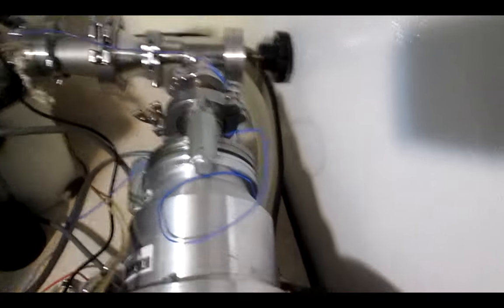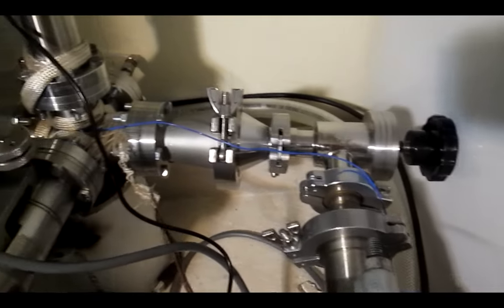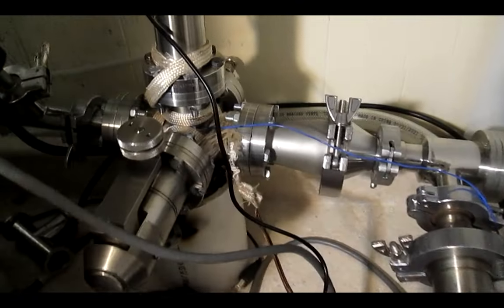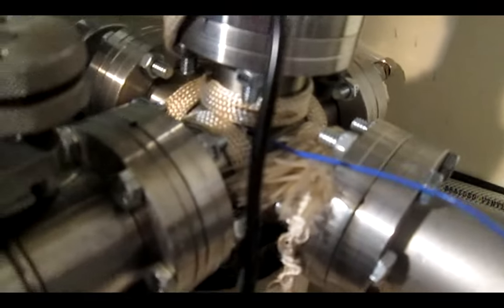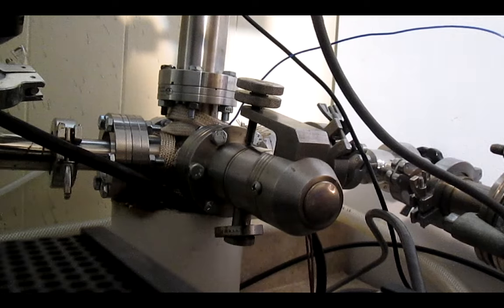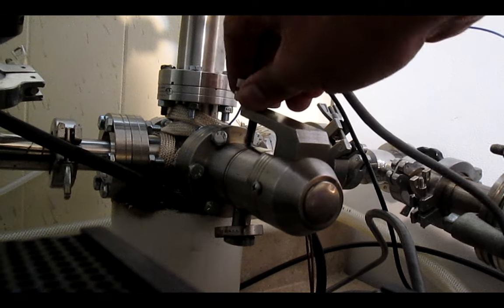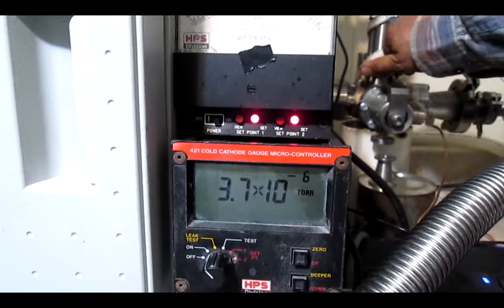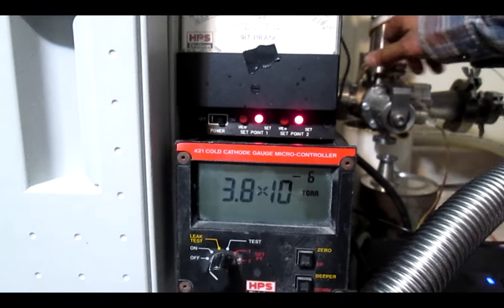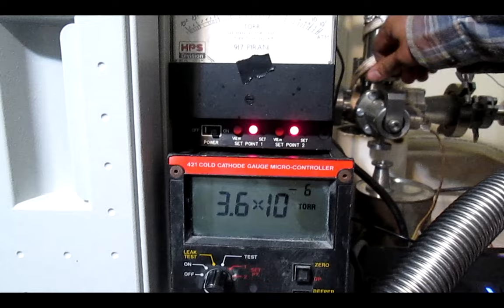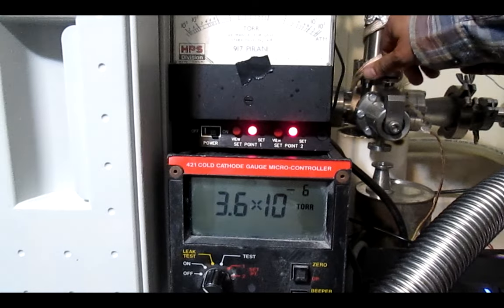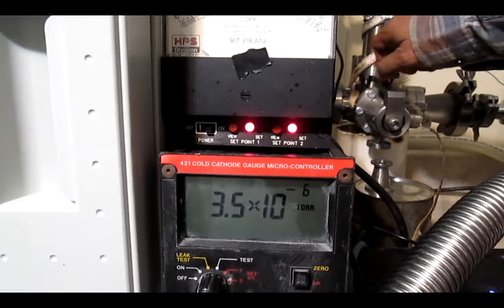The Alcatel Annecy turbo vacuum pump and roughing pump, and all the same gauge tubing, clamps, and general equipment you've seen me using in past videos. The leak valve allows for a controlled leak rate down to 10 to minus 9 torr and is perfect to introduce all kinds of liquids and gases without having to break the vacuum for every sample.